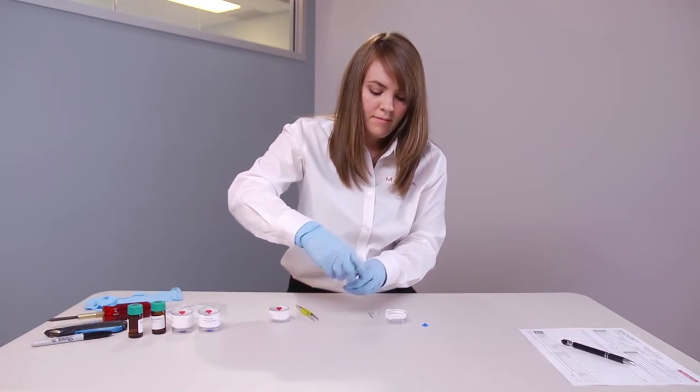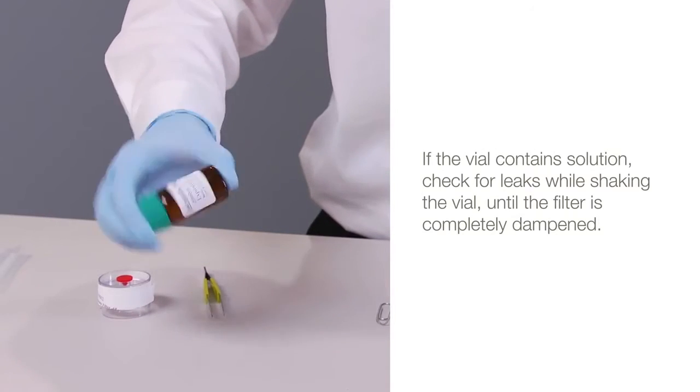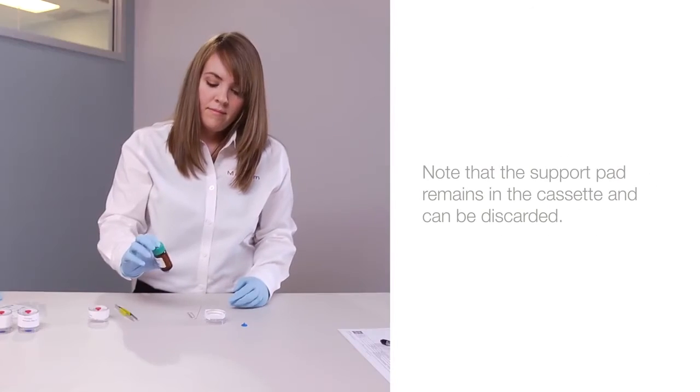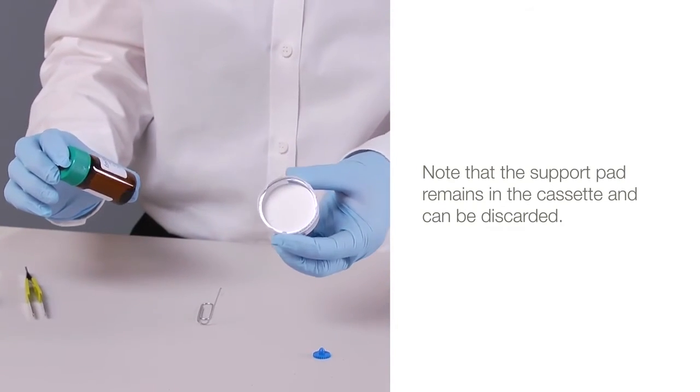If the vial contains solution, check for leaks while shaking the vial until the filter is completely dampened. Note that the support pad remains in the cassette and can be discarded.